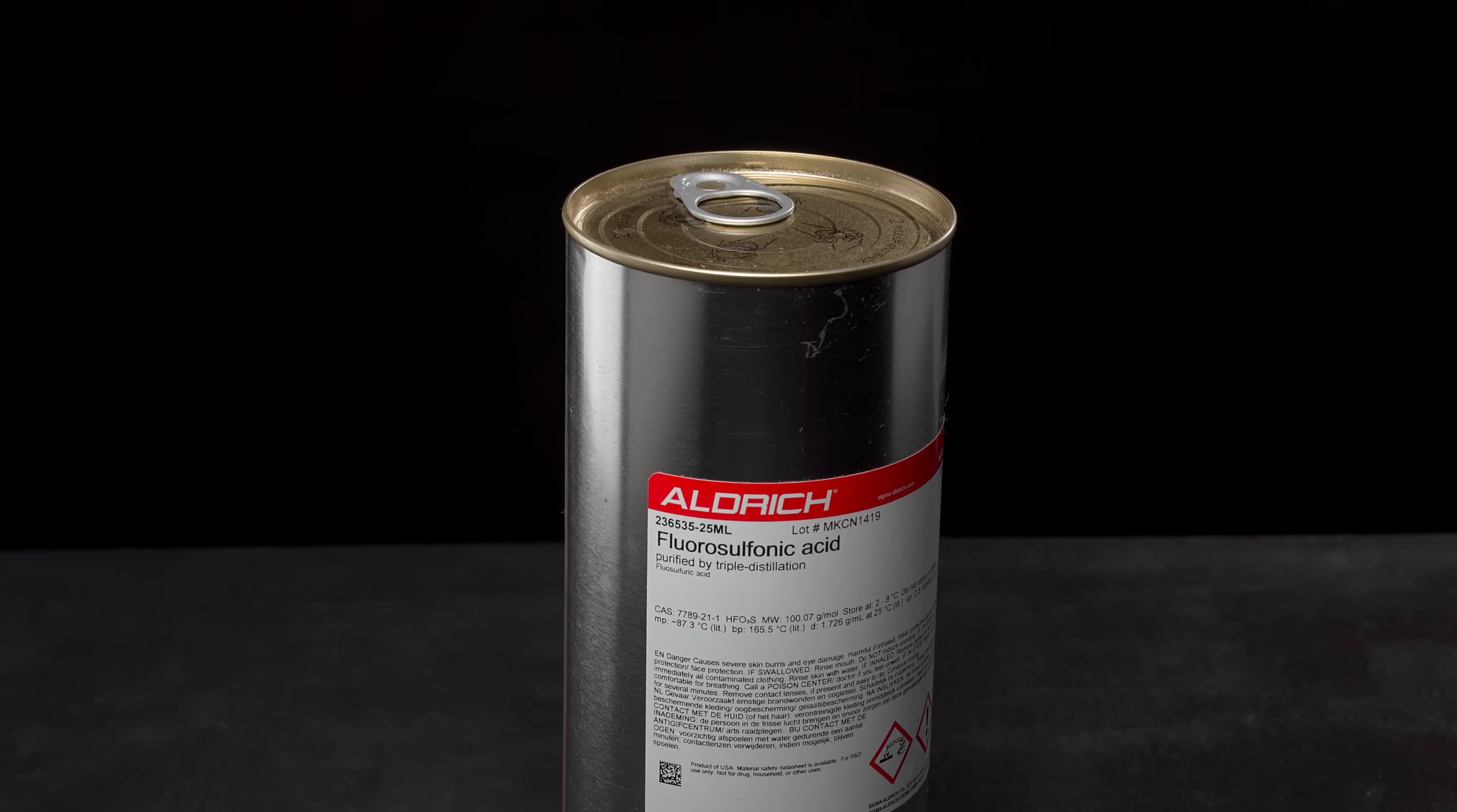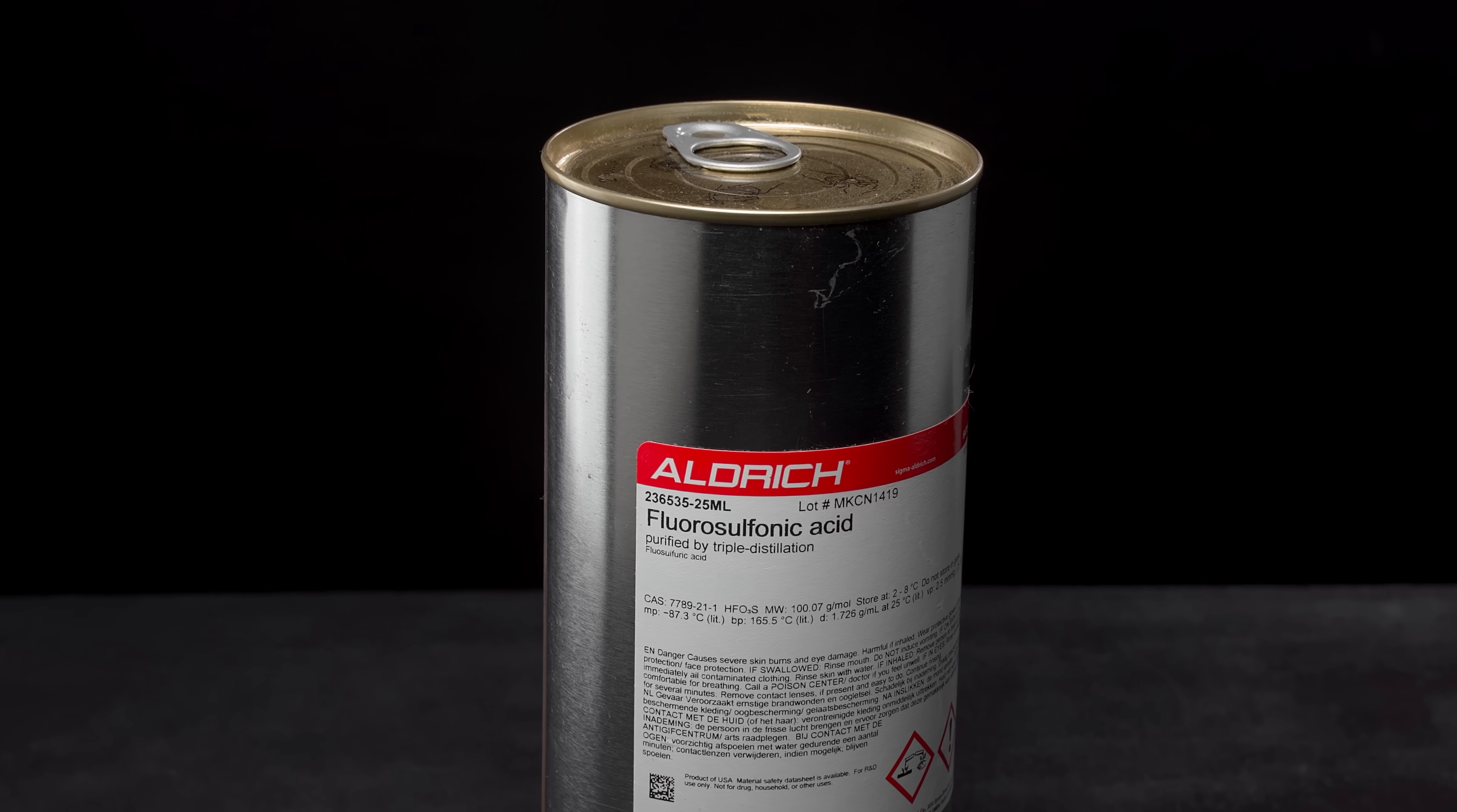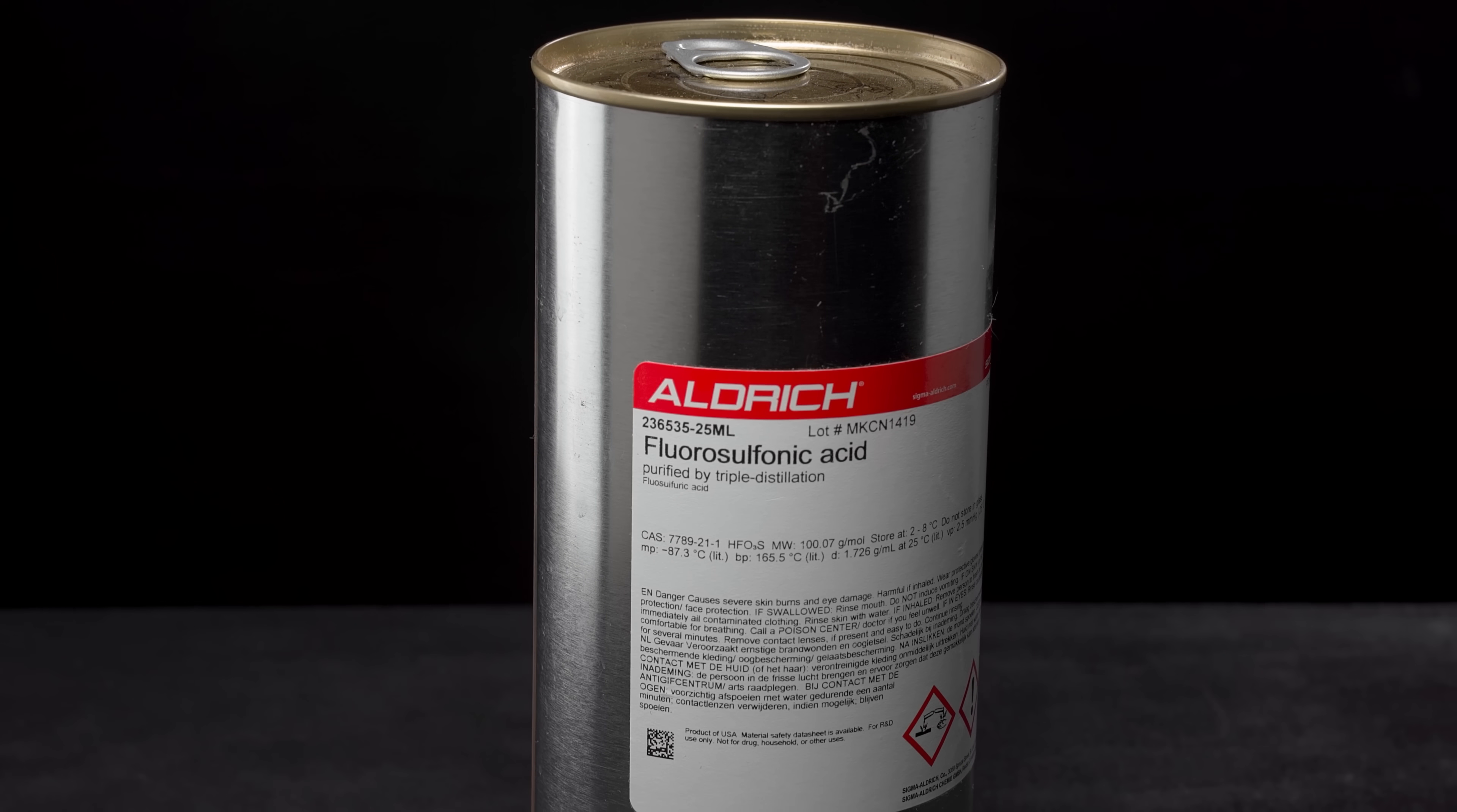Like most of our Sigma Aldrich chemicals, fluorosulfuric acid is very well packaged too.